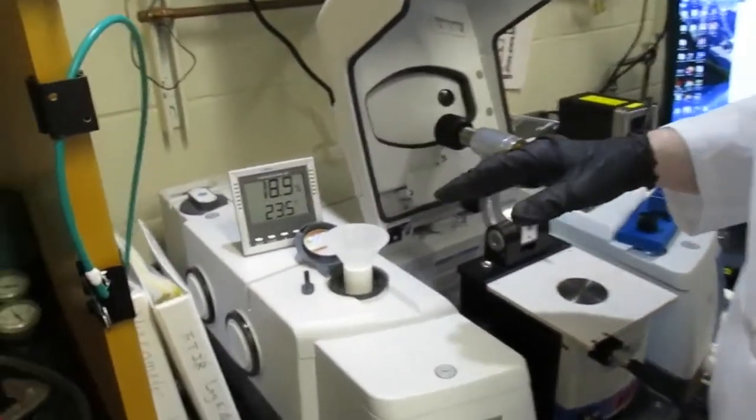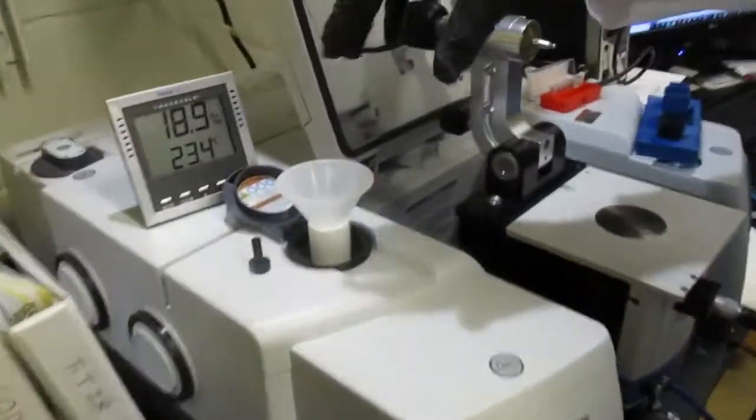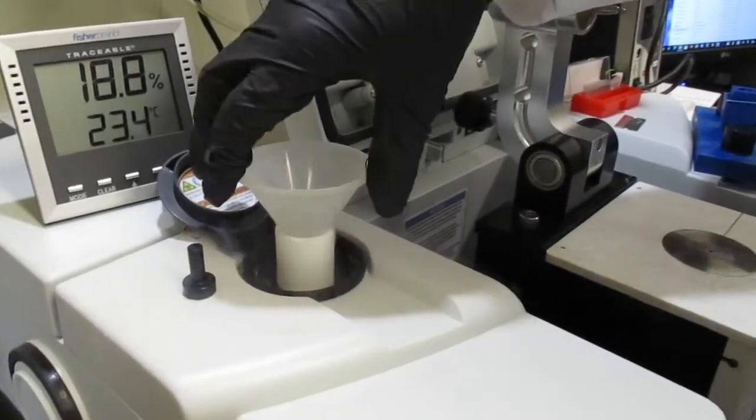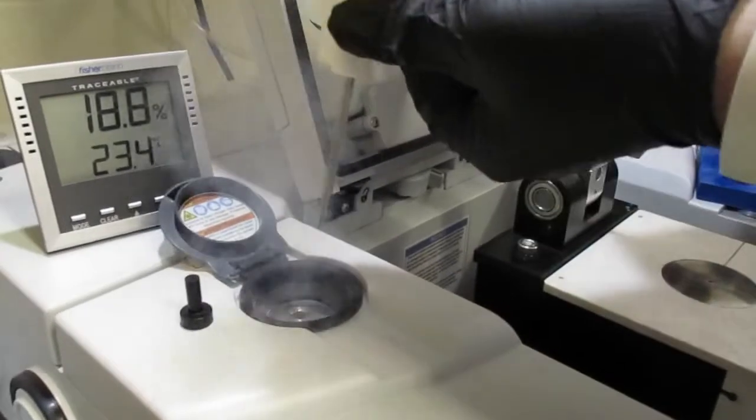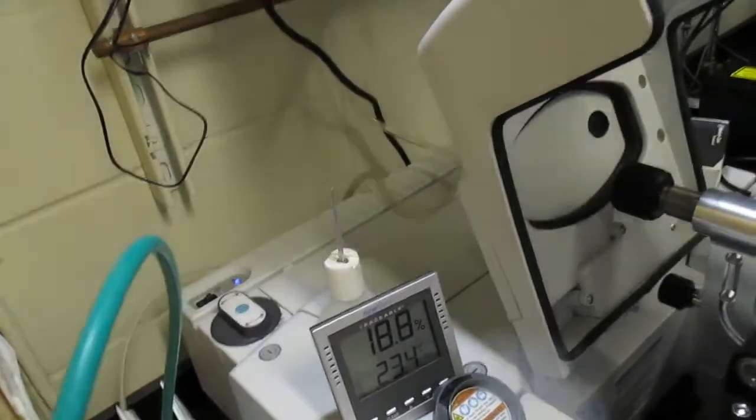So just carefully wait for the funnel to heat up a little bit, and with the gloved hand you can grab the edge, and then you can grab the styrofoam and place it in the back.